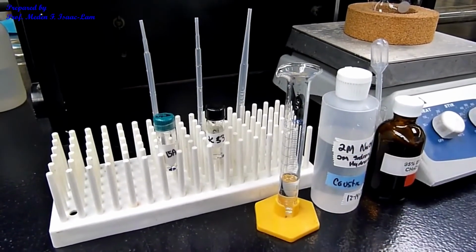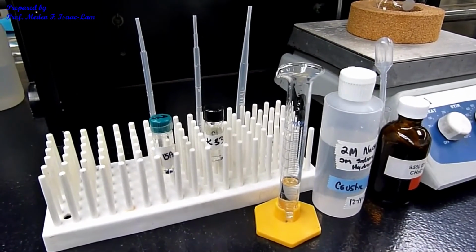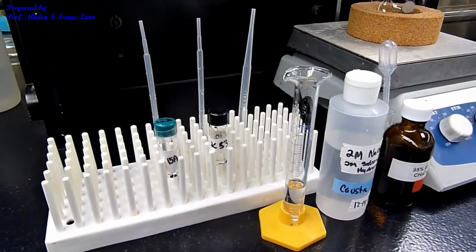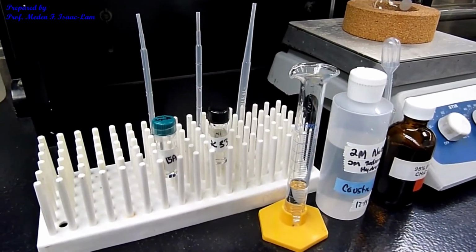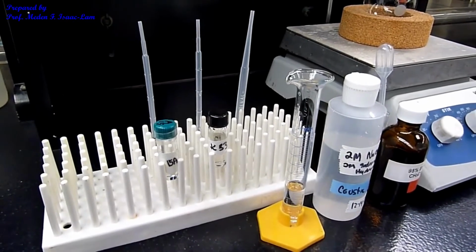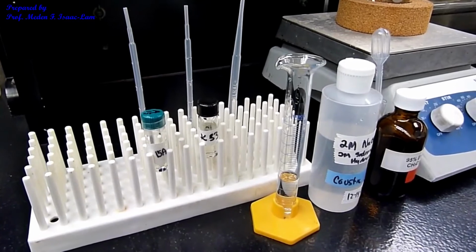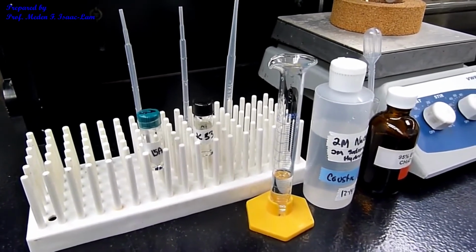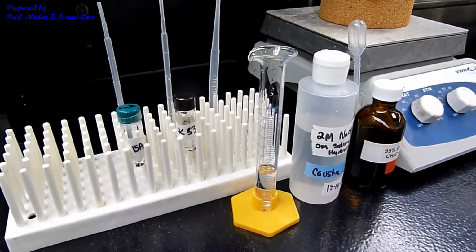that's the ketone unknown. So the experiment is you are going to make a combination, and then you are going to identify at the end what the aldehyde is and what the ketone is. The aldehyde is going to be in excess, and the ketone is going to be in lesser amount. So the aldehyde is 4 times the amount of the ketone.